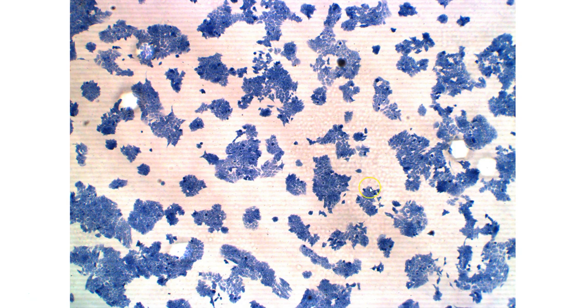Now, you will look at this and imagine what percentage of the surface is covered in cells. So if the entire image is 100% surface area, what percentage is blue? In this case, I would say that about half the surface area is covered in cells and the rest of it is still white. So I would write the confluency of this culture as 50%. That is how you would do that.